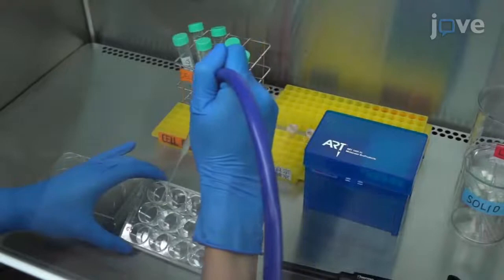At the end of the fixation, wash the wells with PBS and stain the cells with 0.5 mL of staining solution.